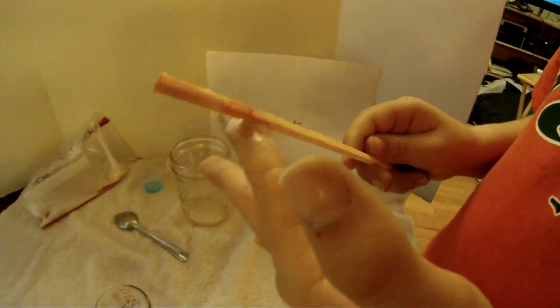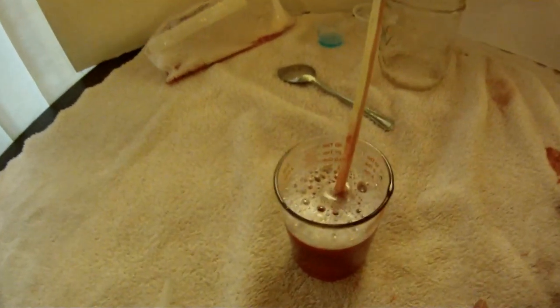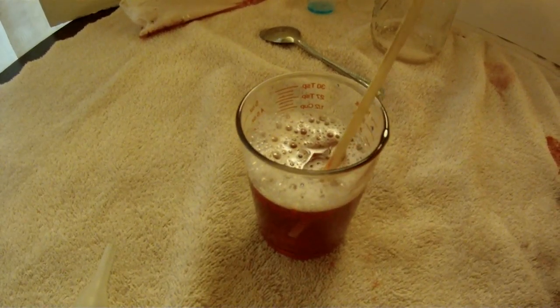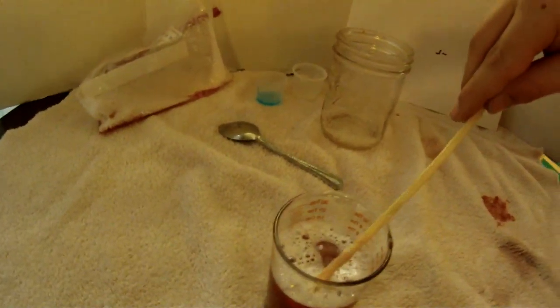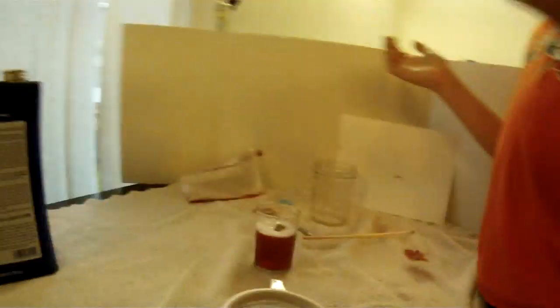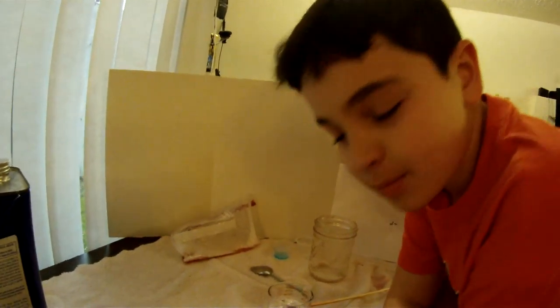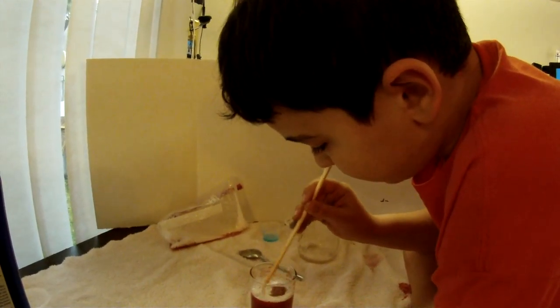You got too much foam so you can't see the DNA for the foam. The DNA will feel more like jello - I'm trying to find it through the foam. DNA will feel more like jello and hopefully the DNA will come out.